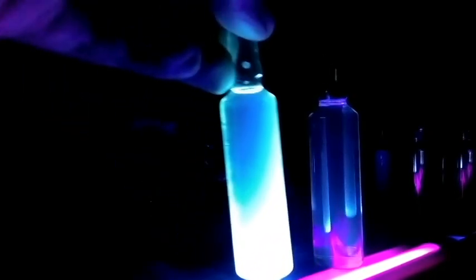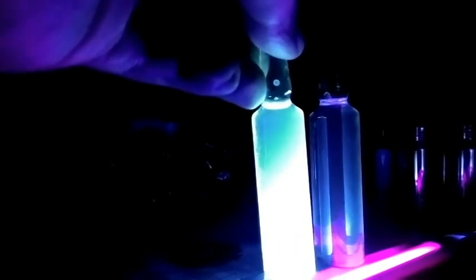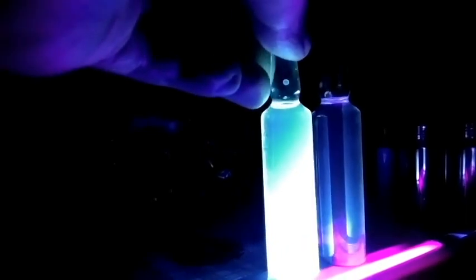Some people might ask, ordinary table sugar also has weak fluorescence. Maybe there are quantum dots too, since the weak fluorescence can be produced by simply heating the purified sugar without fluorescence. My starting material has no fluorescence, and the color and intensity are different from ordinary sugar solution.